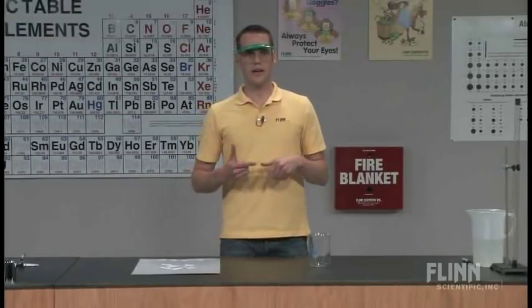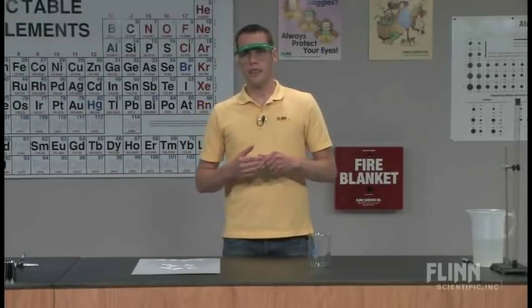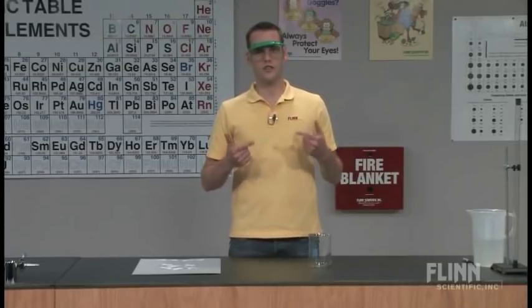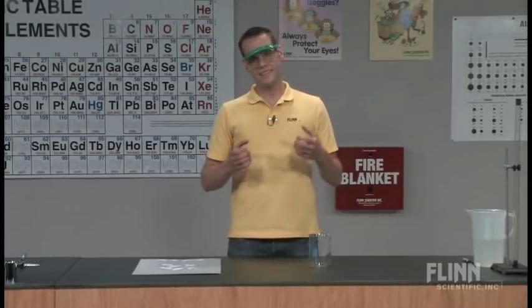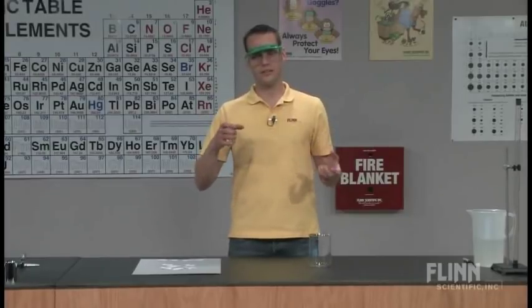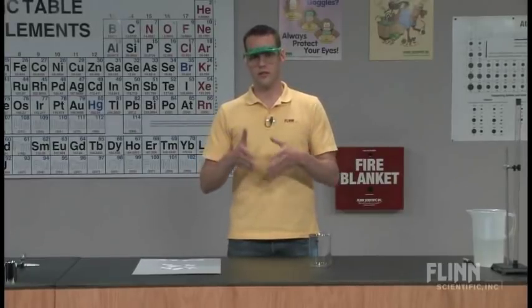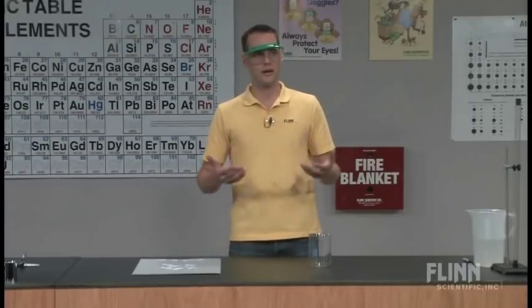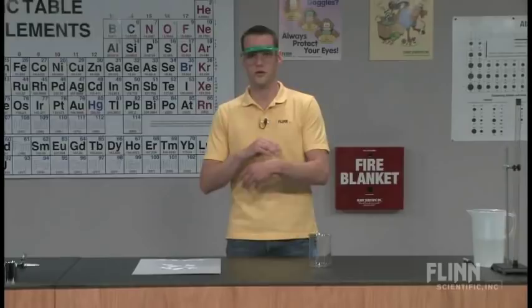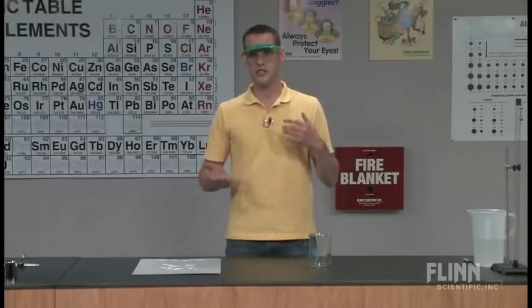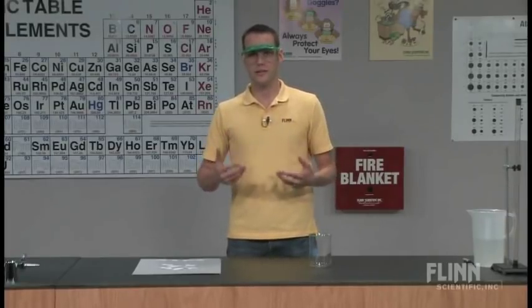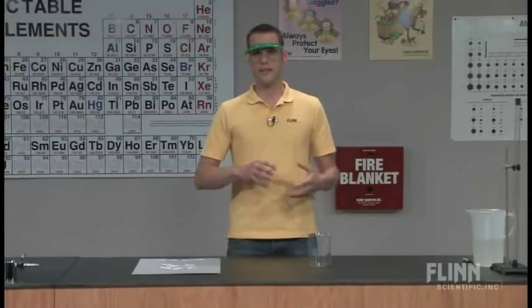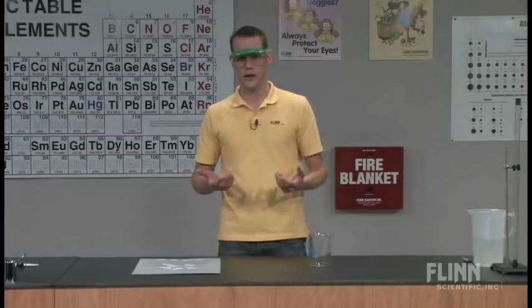I discovered that my students have a law of conservation of their own that I was completely unaware even existed, and they call it the law of conservation of volume. They are quite convinced that when you mix two liquids together, 50 milliliters of one or 50 milliliters of the other, it will add up to 100 milliliters no matter what. So there are a couple of demonstrations you can use to clarify this and really get a visual picture for students to see what's going on.